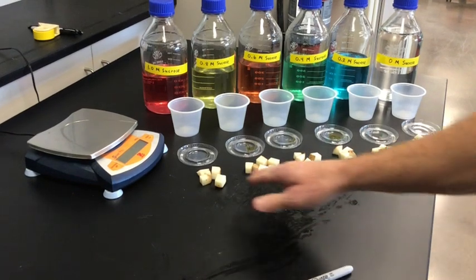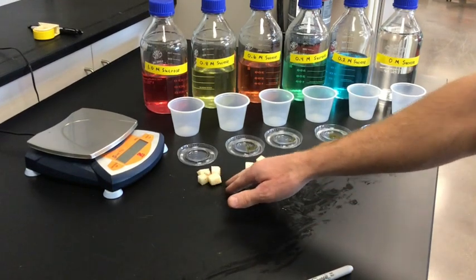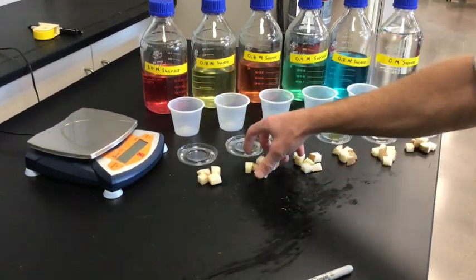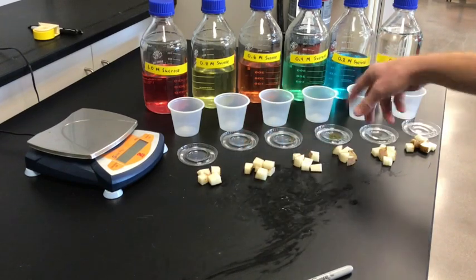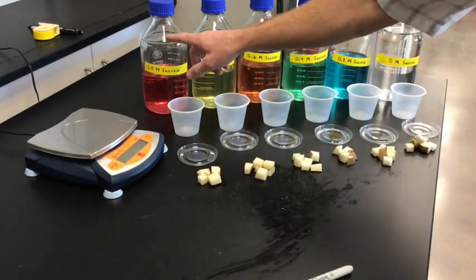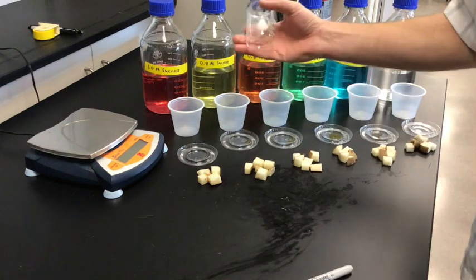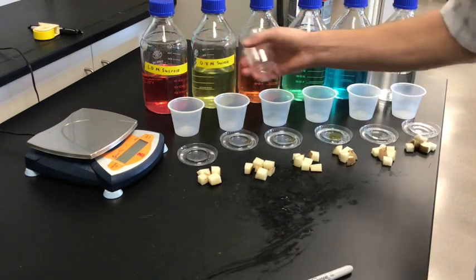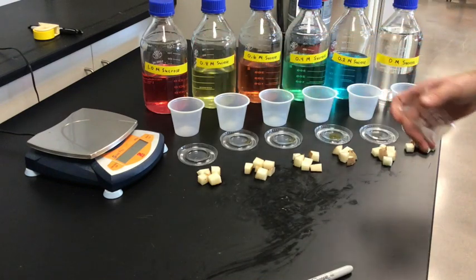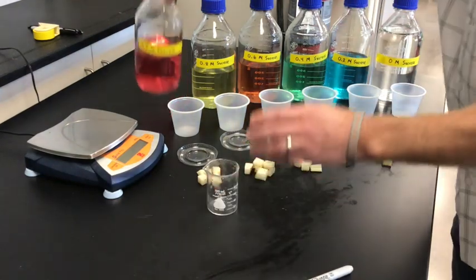As you can see, I've got the potato cut into pieces and the pieces grouped together for each of the containers. Now I'm going to go ahead and put about 50 milliliters of each solution into the cups to get ready for the next step.